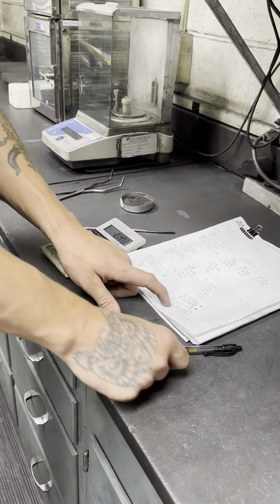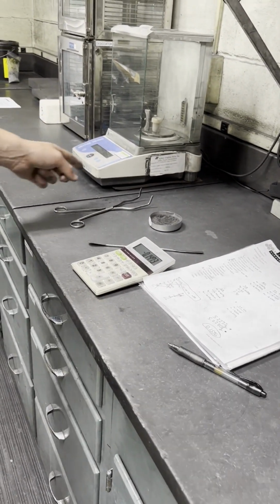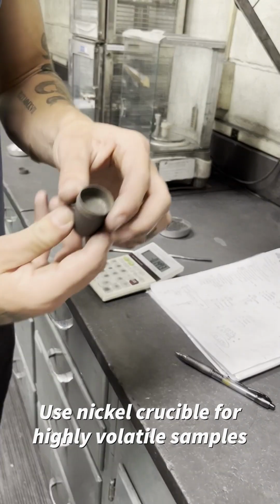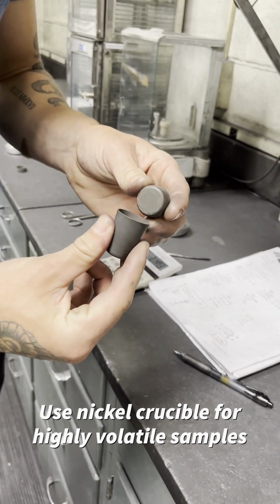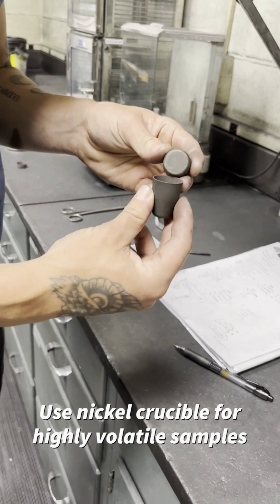And if you had a very high volatile and the lid blew off during the analysis, this is when you would use a nickel crucible with no hole in it. This is like a tight locking crucible. So when I have a very volatile sample, it's not going to let any gas or any sample escape.